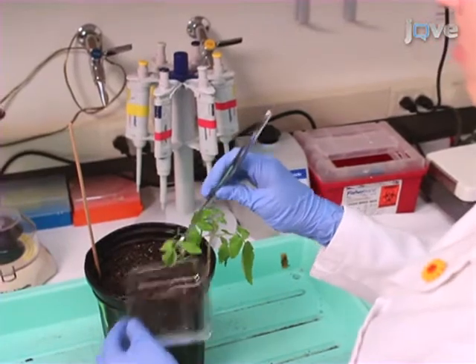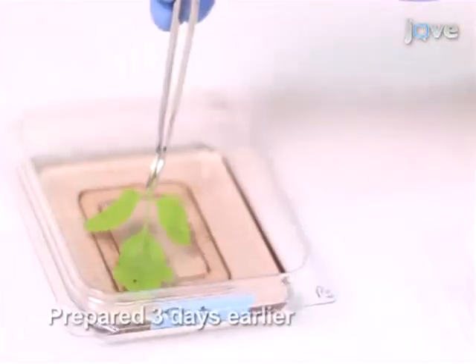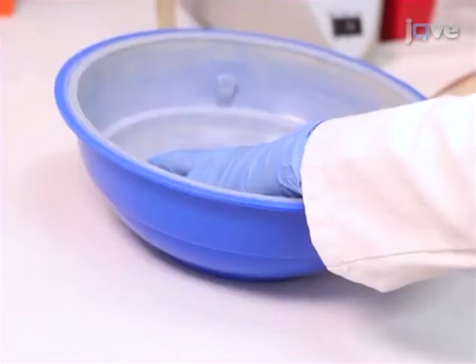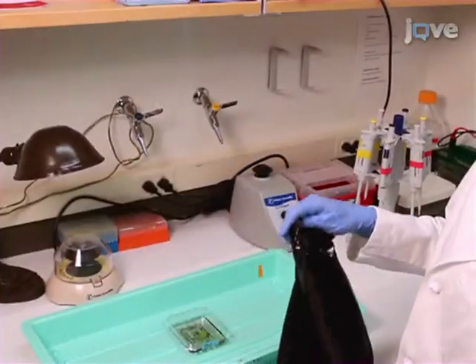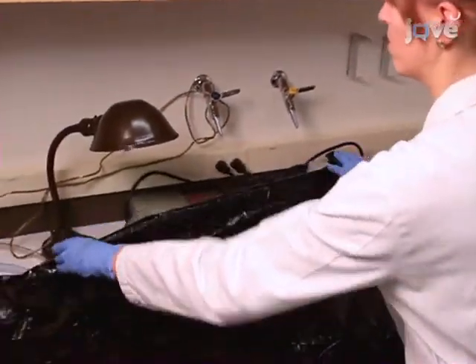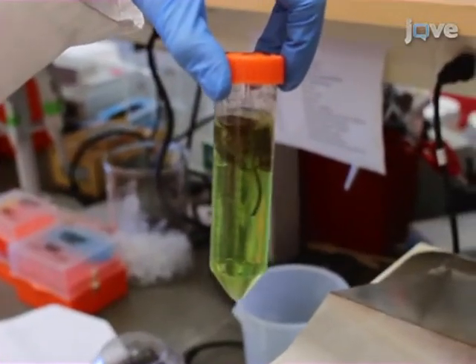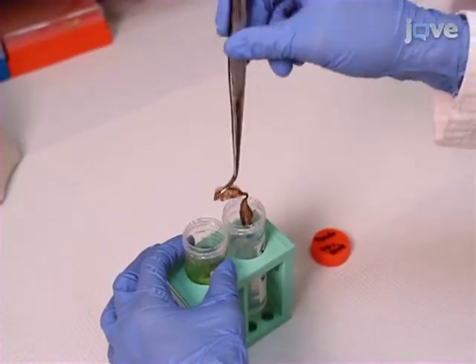After the preferred inoculation time, harvest the fully expanded leaf. Place epidermal side up in 1 mg per milliliter DAB stain and vacuum infiltrate for 15 minutes. Then, incubate leaves in the dark at room temperature overnight. Now boil the stained leaves in 95% ethanol for 10 minutes and store in 75% ethanol.